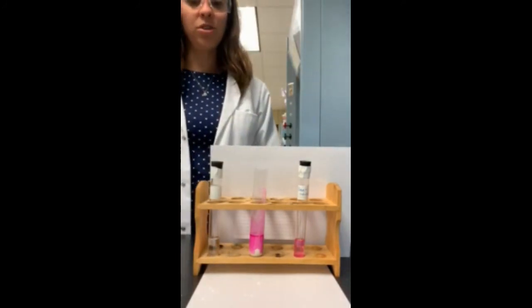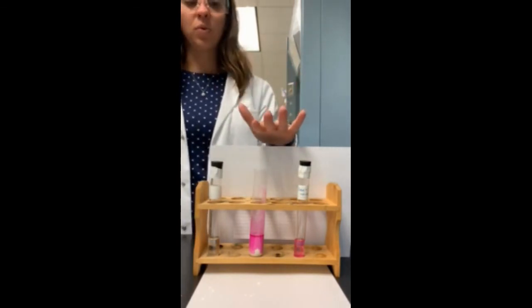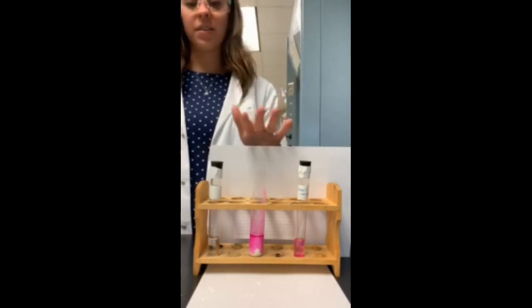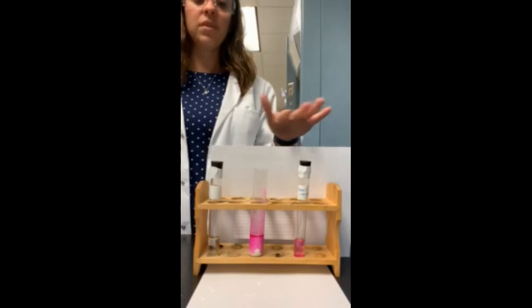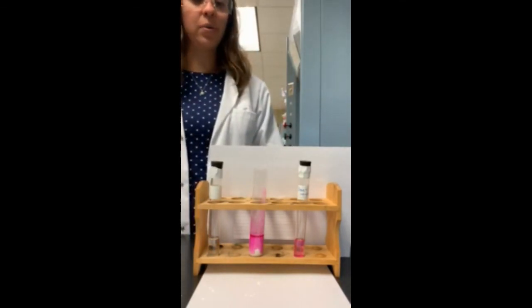So at this point, you should now be able to make a decision about what we formed here. Does calcium oxide plus water synthesize a base, or does calcium oxide plus water synthesize an acid? At this point, you should now complete the remaining questions that go along with this reaction.